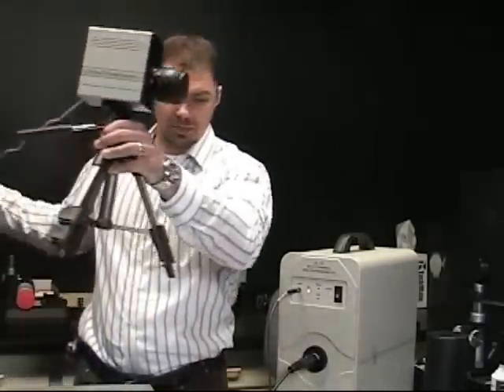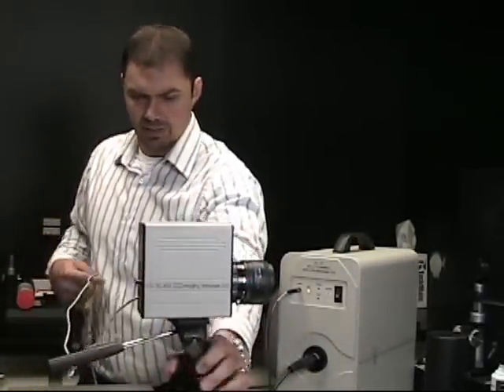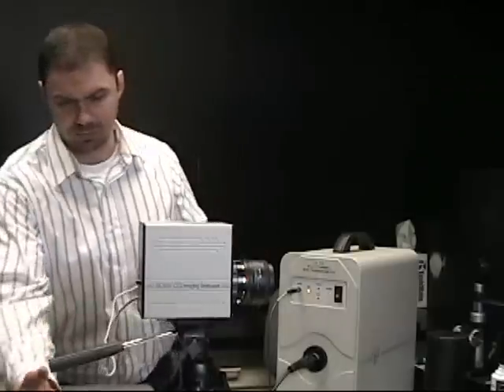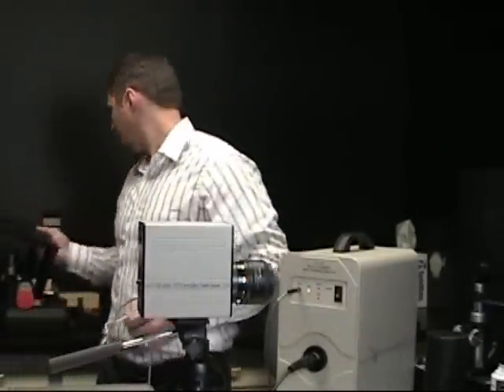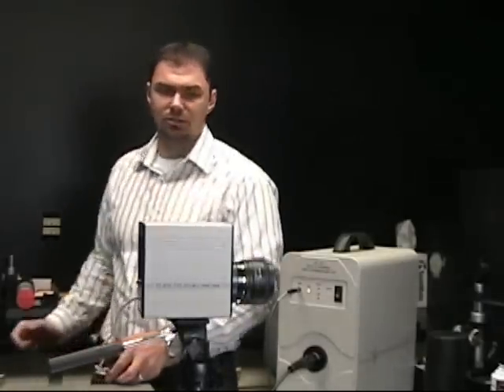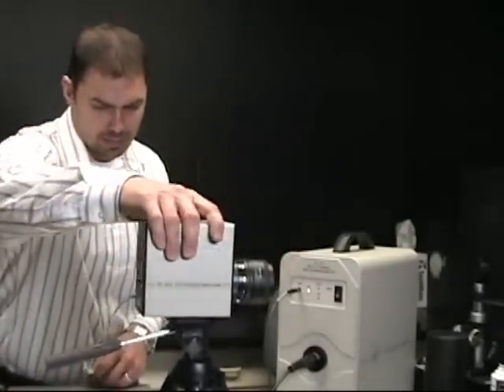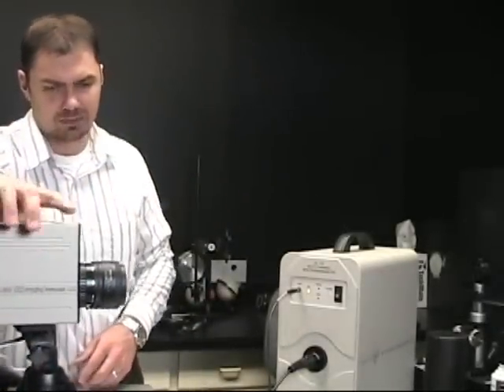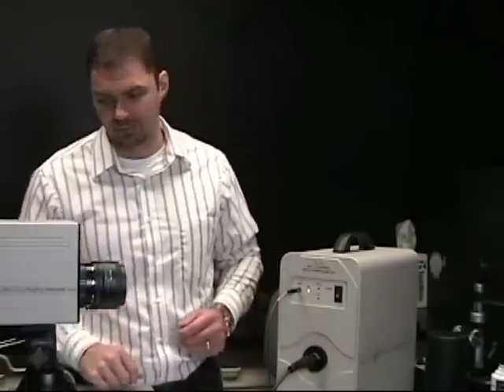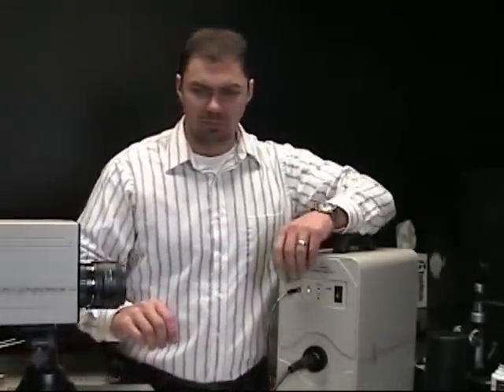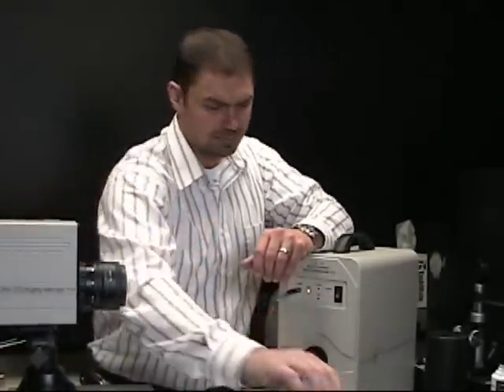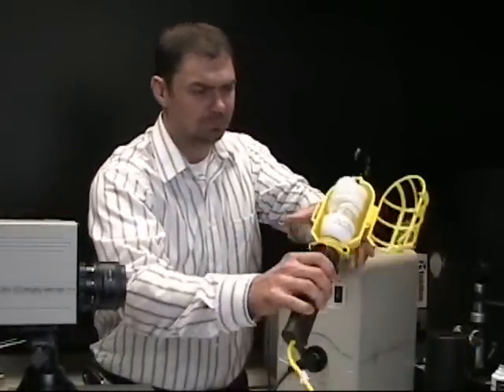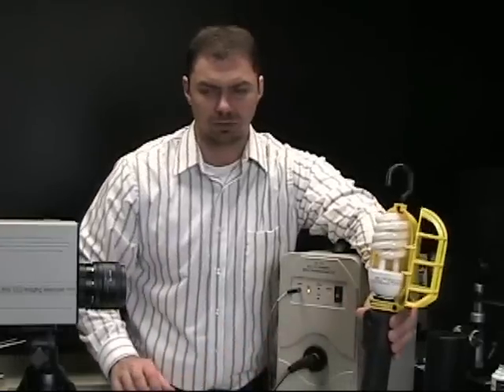Now this imaging telescope here is different than the one that you were quoted, but we don't have one in stock. So for argument's sake, I'll just use this one here. It's the same exact setup, just a different camera. So what you're going to do is you're going to basically set up your system with your lamp in a holder again.